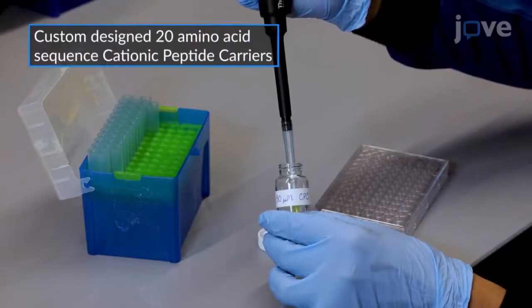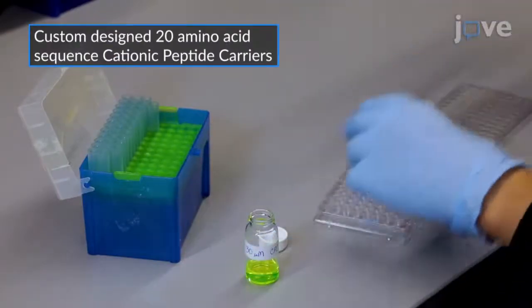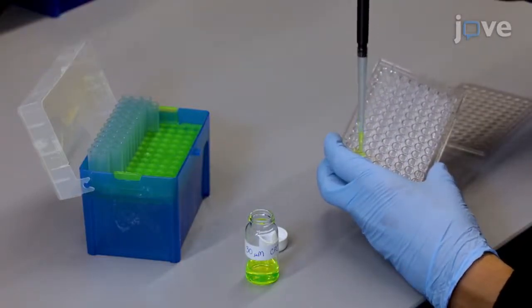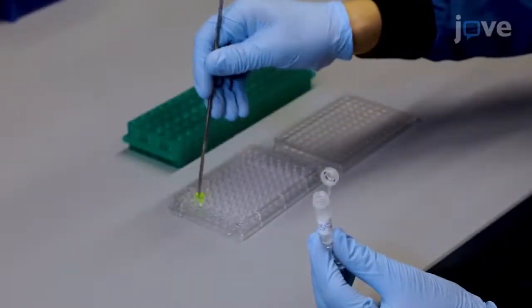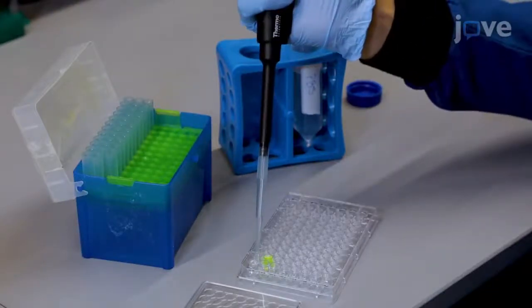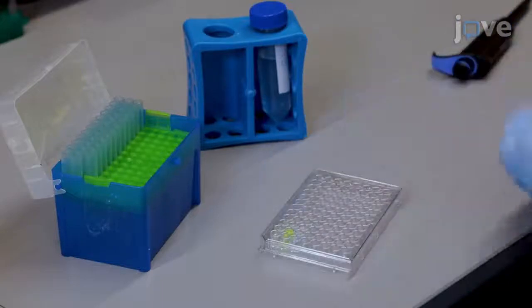Next, add 300 microliters of freshly prepared 30 micromolar fluorescently labeled cationic peptide carrier solution per well to the inner wells of a 96-well plate, and use a spatula to add 1 explant to each well of solution. Fill each of the surrounding wells with 300 microliters of PBS, and cover the plate with a lid.